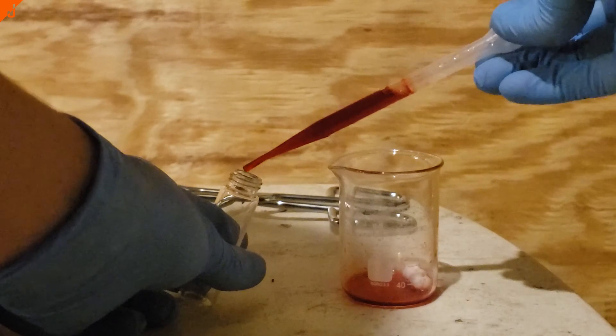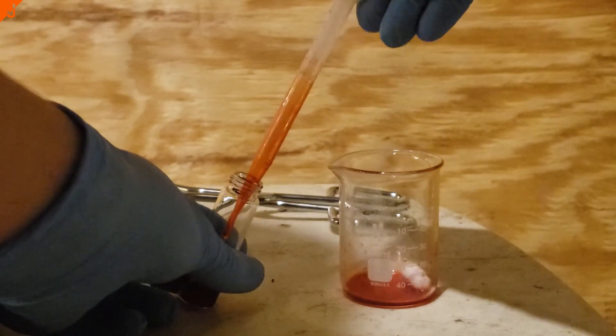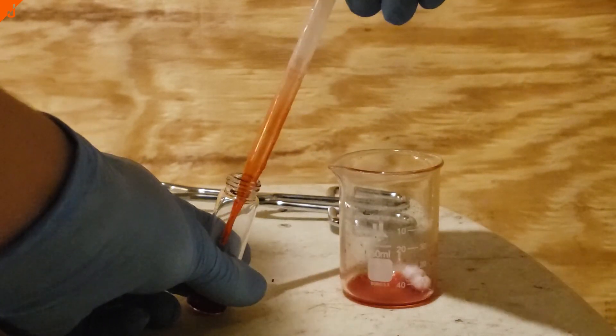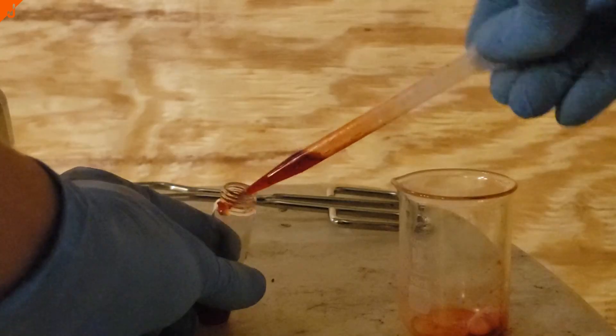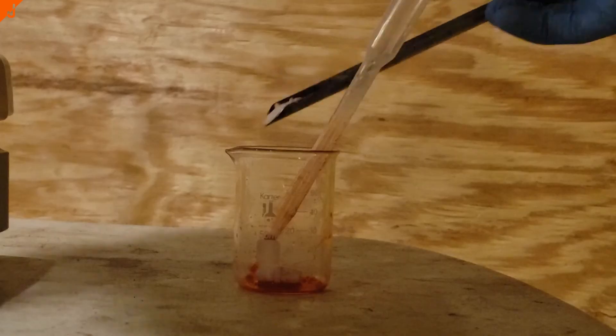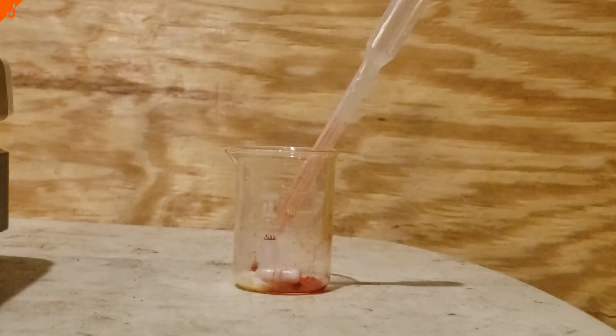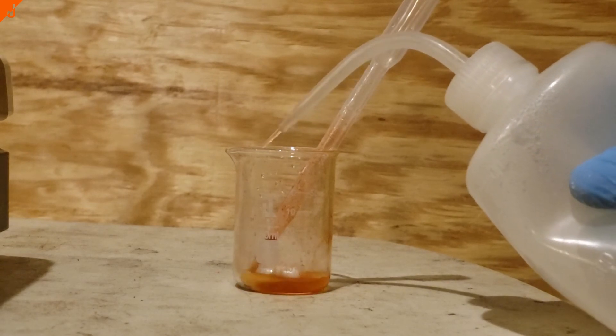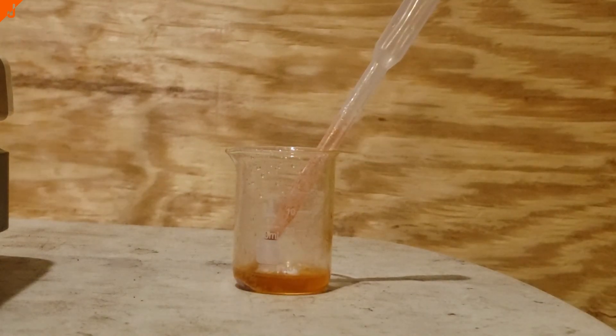Anyway, I then pipetted all of the rosocyanin solution to a vial for storage. To clean everything up, I just used a base, in this case sodium bicarbonate, and that seemed to destroy all the rosocyanin.